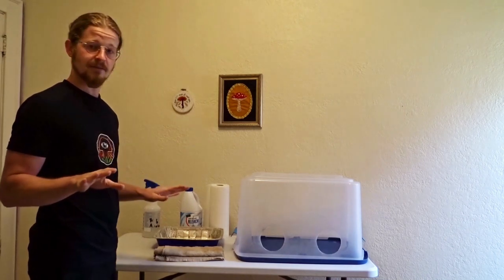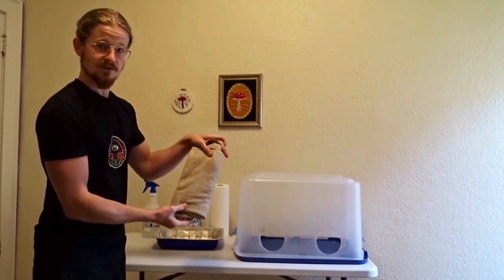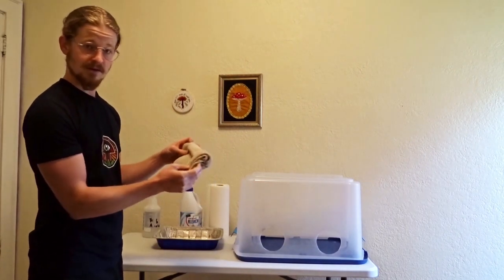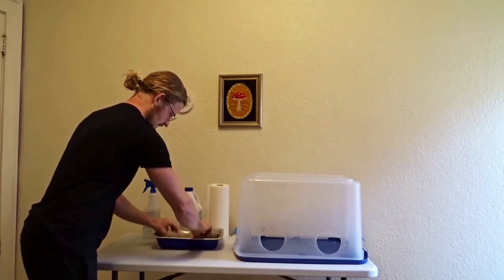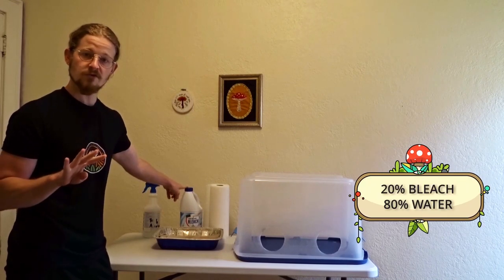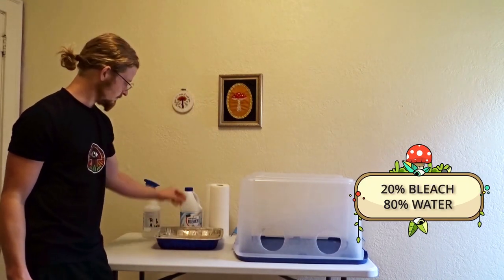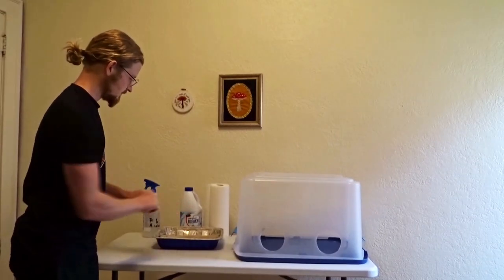The steps are very basic, and there's really only a couple more than you're used to. First step: take your towel — this one's not pretty, but it's clean — and drop it in the bleach water and get it soaked. For this I use one part bleach, four parts water, but for a size this small, one cap of bleach is more than enough.